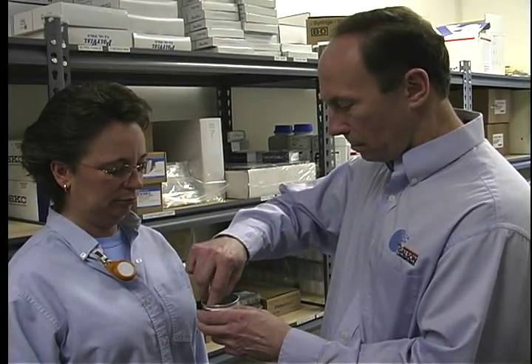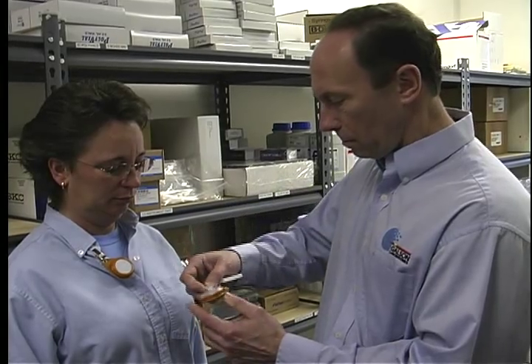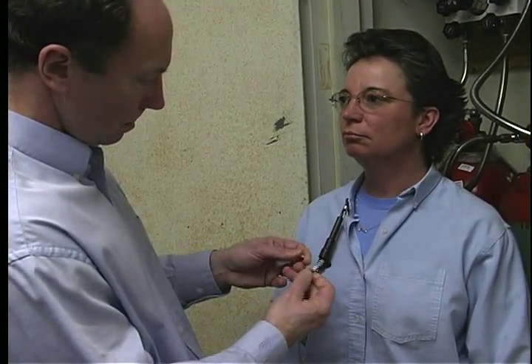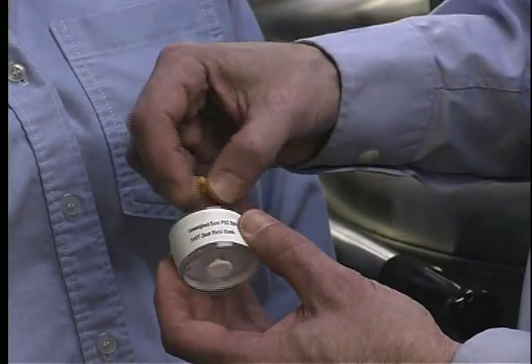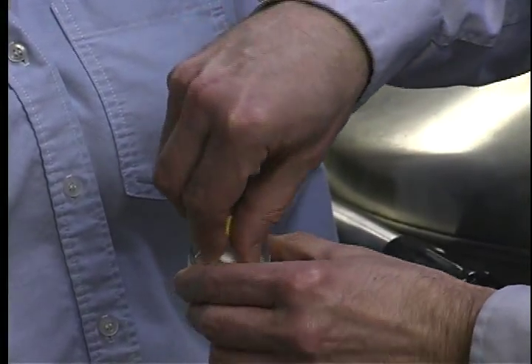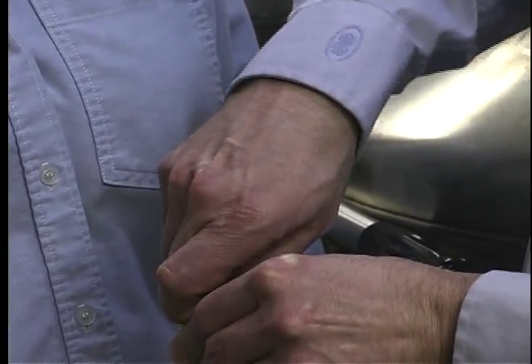Collecting field blanks appropriately protects you from unknown contamination of your media during your sample collection, storage, and transport processes. Contamination could cause your sample results to be reported higher than they should be. Obviously, it is not your intent to introduce any contamination to your sampling media.